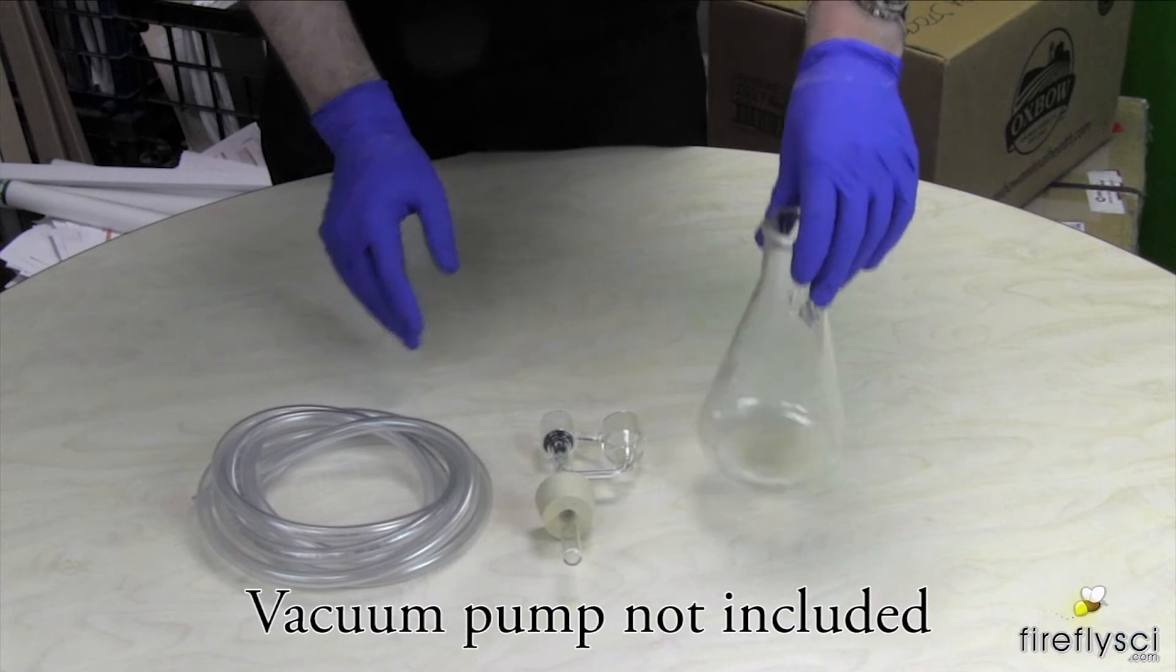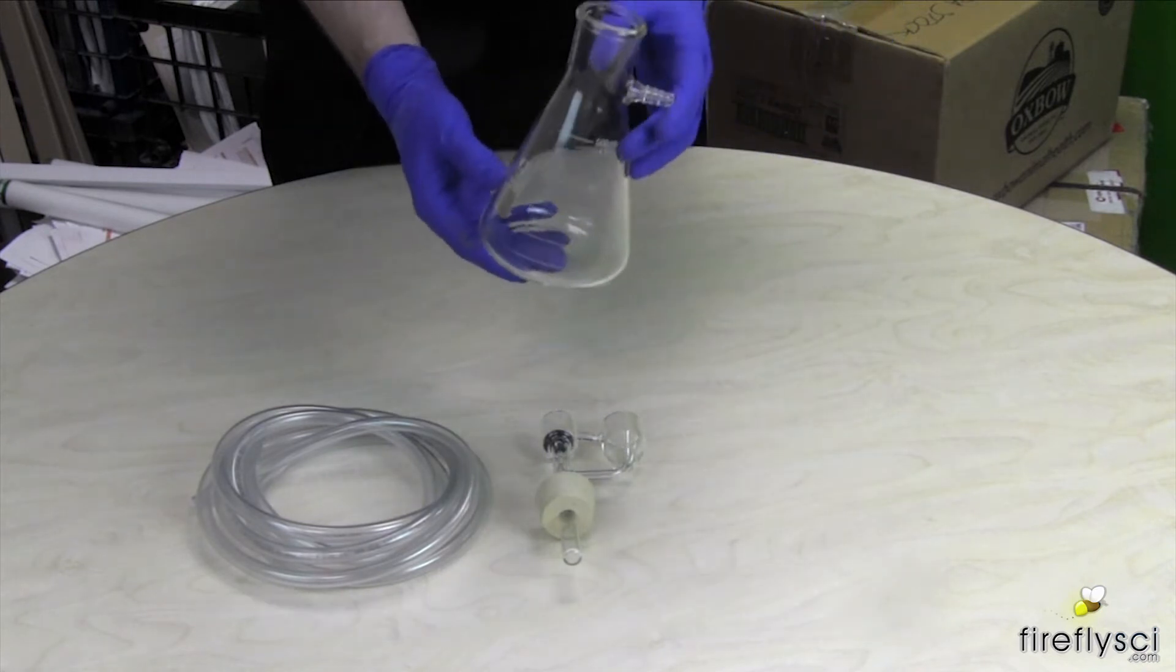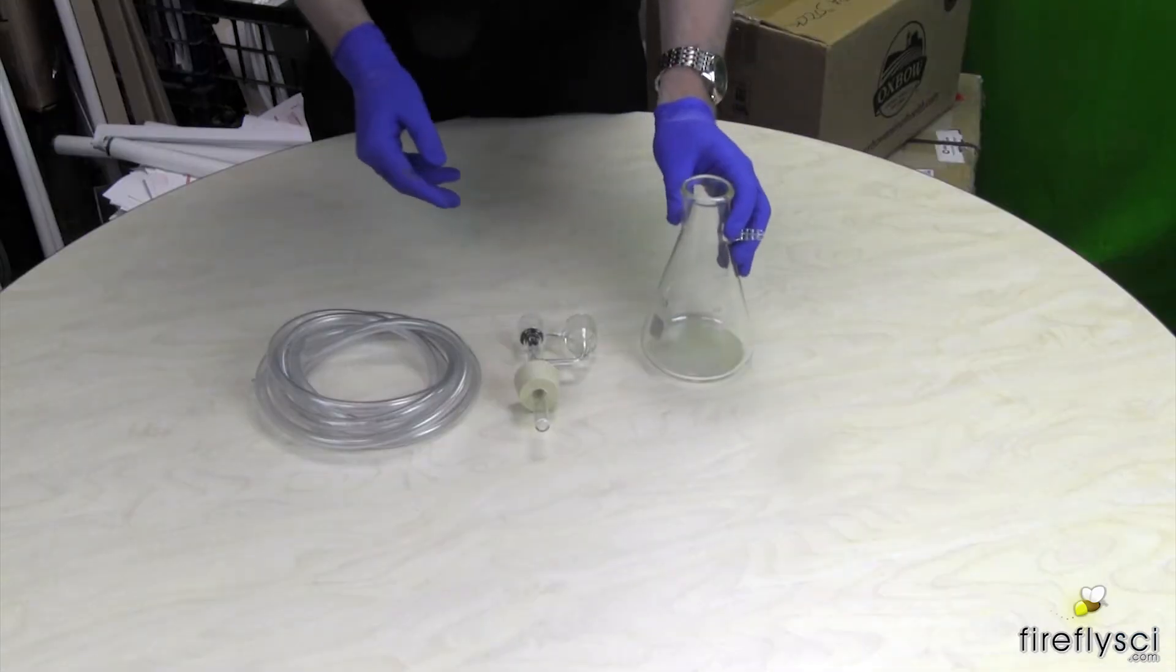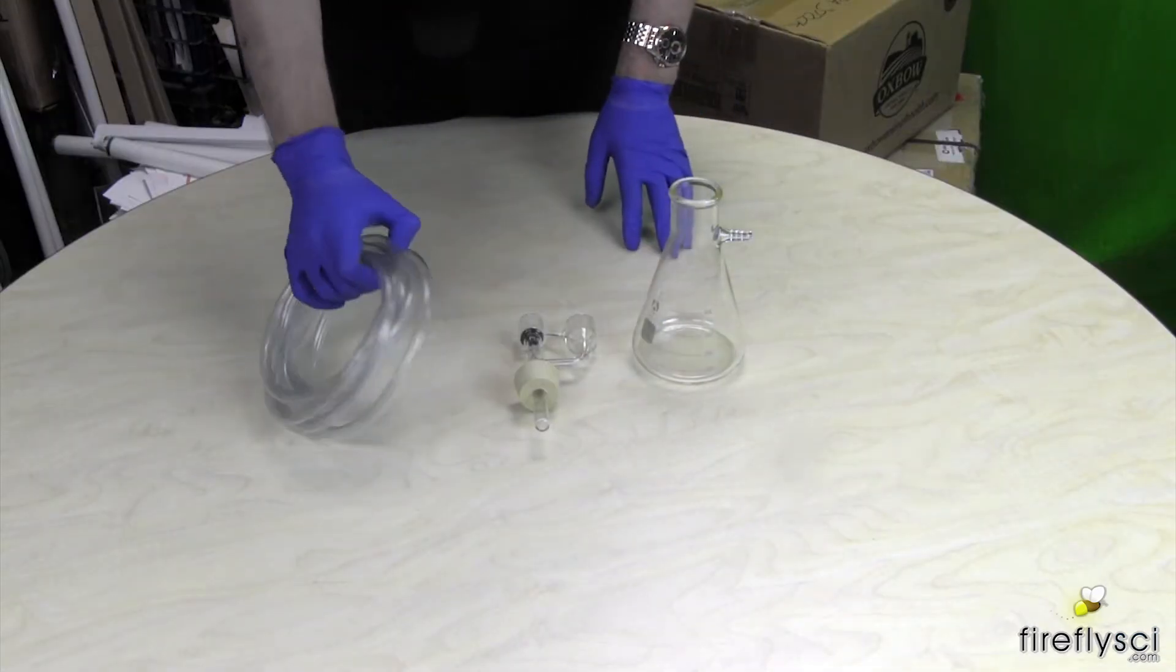It also comes with a 500 milliliter filtering flask and of course 10 feet of tubing.